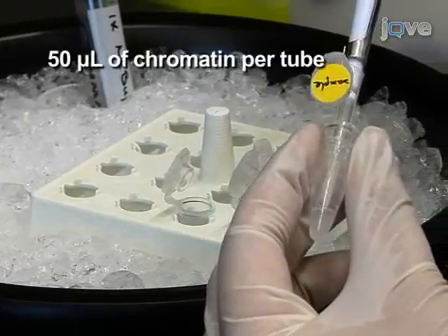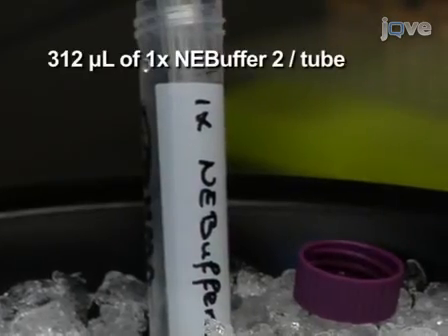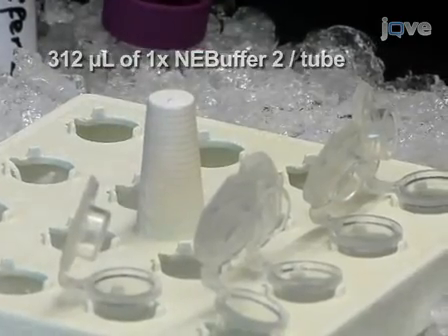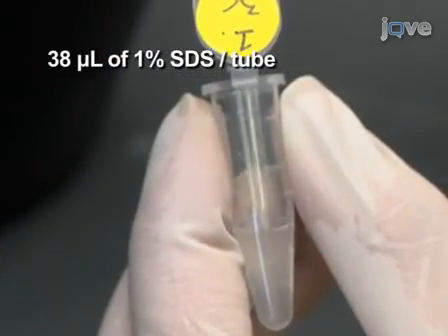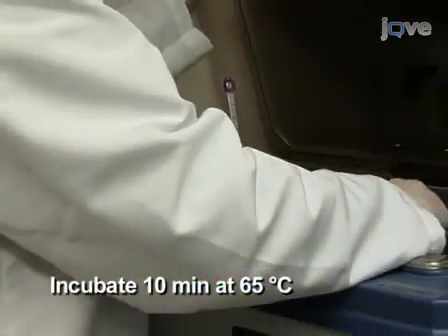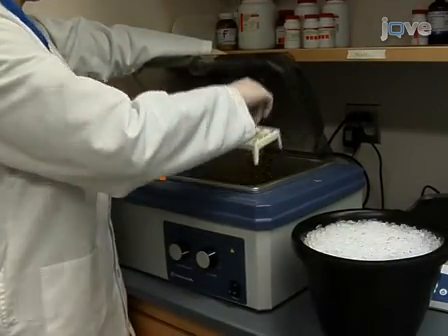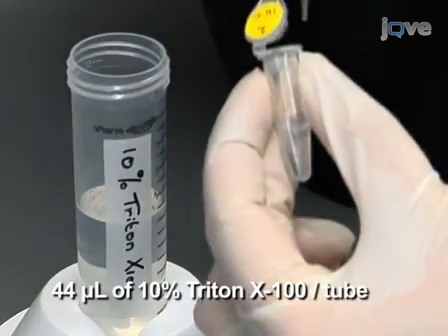Aliquot into 5 numbered tubes and add NEB buffer 2 to a final volume of 362 microliters. Add 38 microliters of 1% SDS, mix carefully, and incubate at 65 degrees Celsius for 10 minutes. Place tubes back on ice immediately and quench the SDS by adding 44 microliters of Triton X-100. Mix carefully.